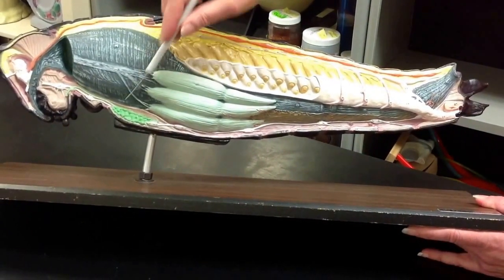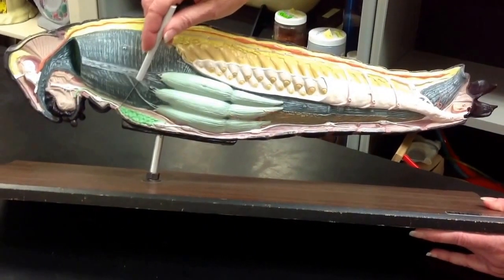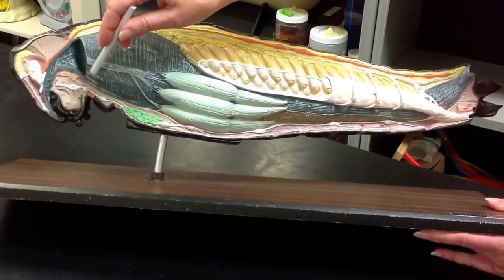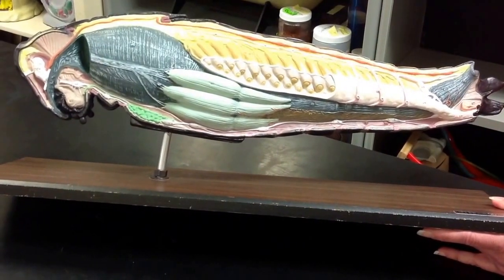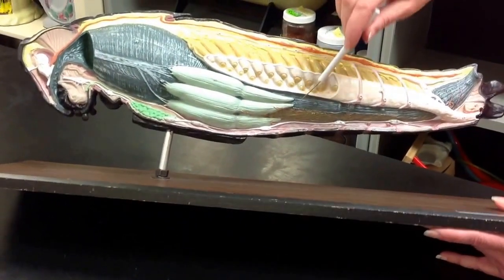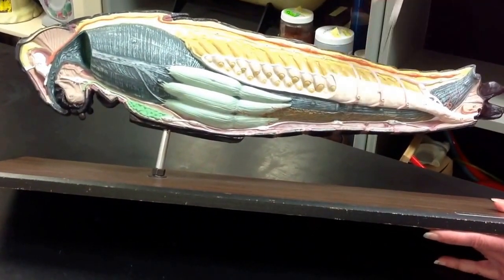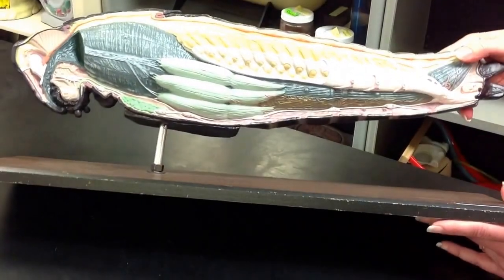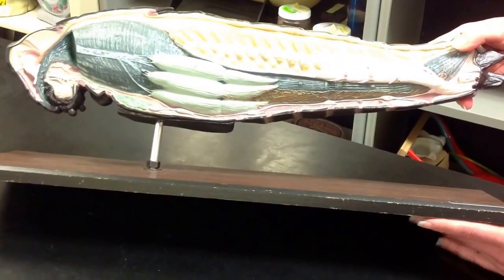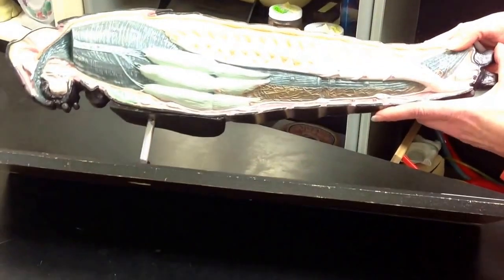This green thing here is the salivary gland that secretes saliva into the mouth. These brown squiggly things are the Malpighian tubules, part of the excretory system.